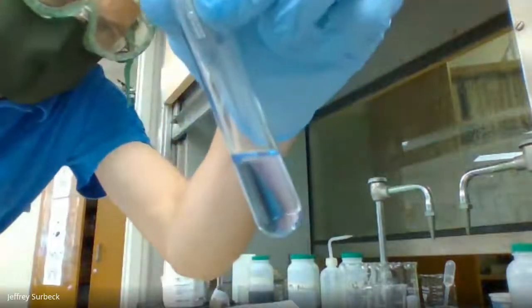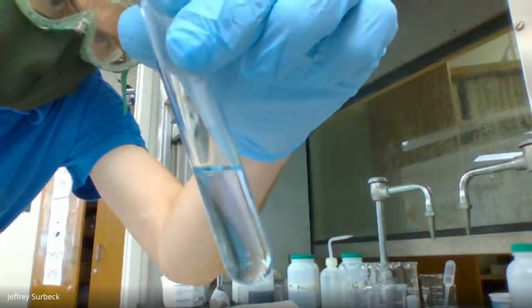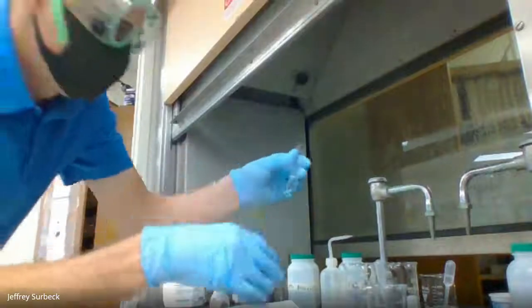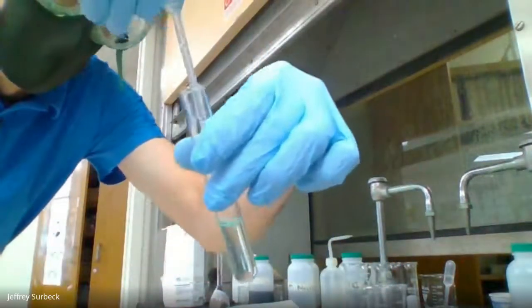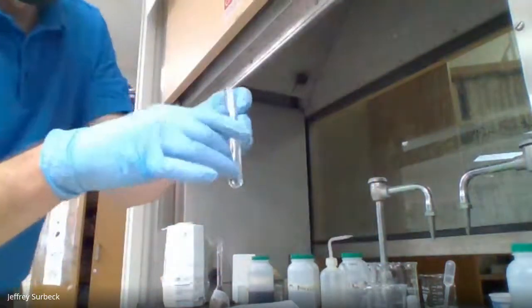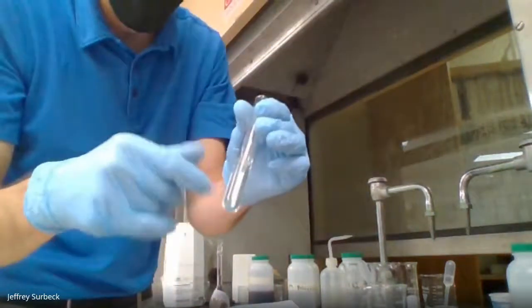Add some more. And I'm going to add just a little bit more. Okay, so I had to add a little bit more HCl than what I thought.